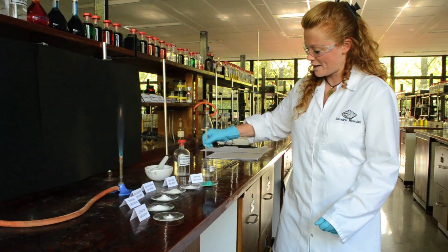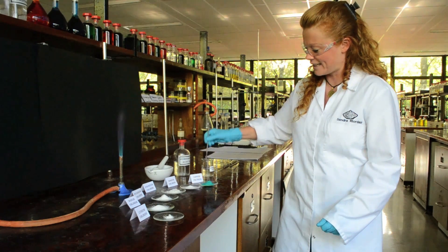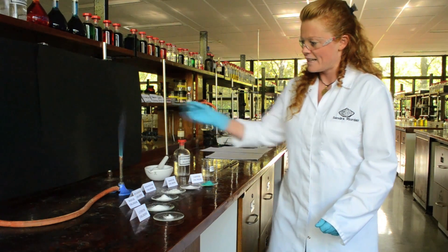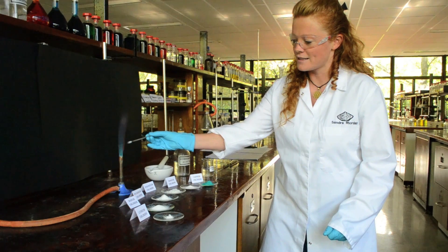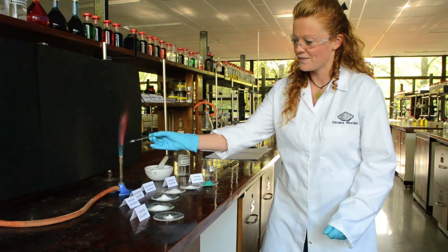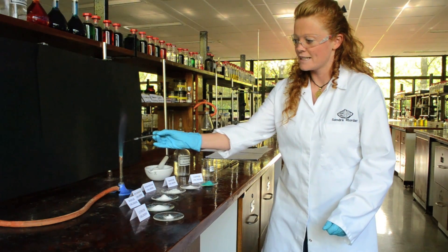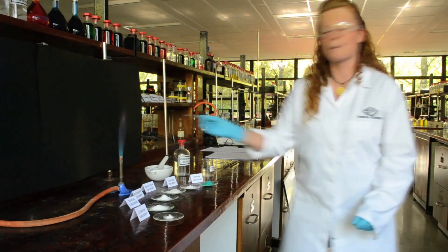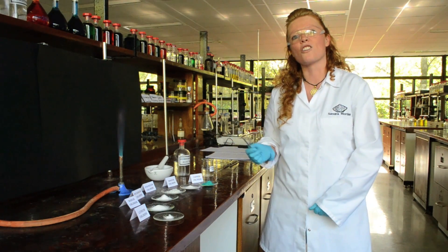You place the wire in the hydrochloric acid to clean it and back into the flame to ensure that it's been cleaned. This procedure will be repeated for each of the metal salts.